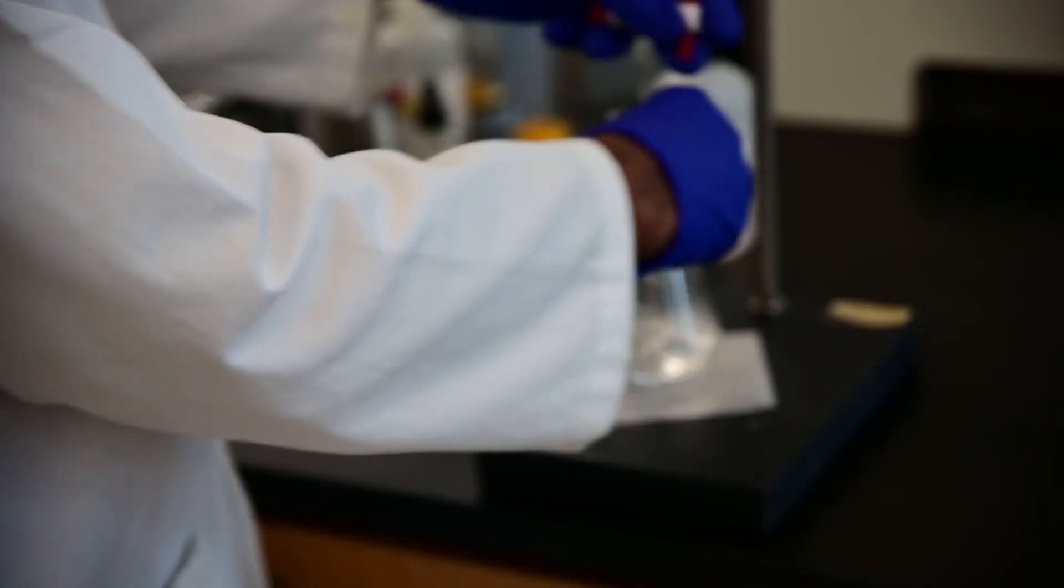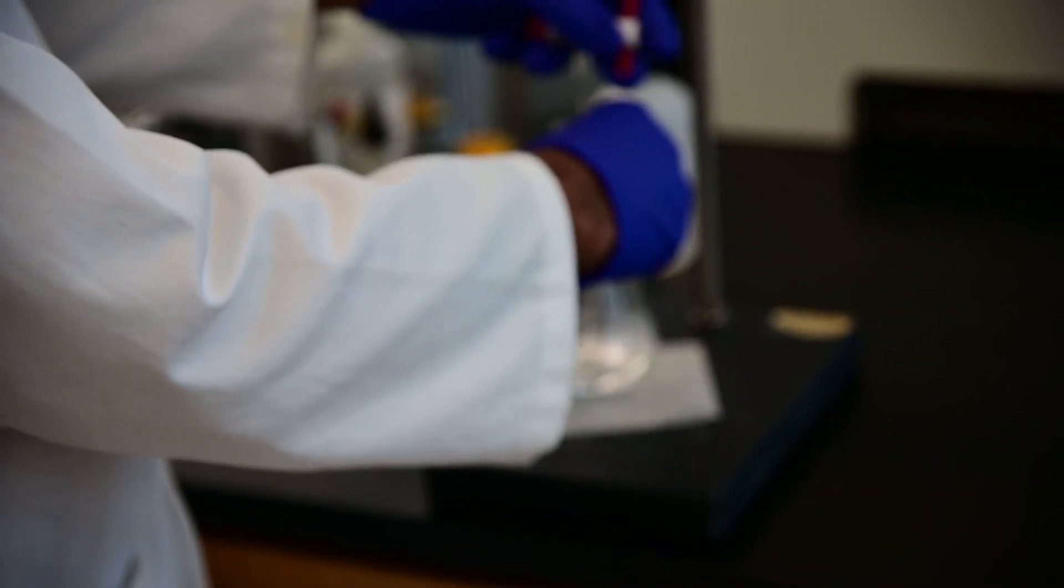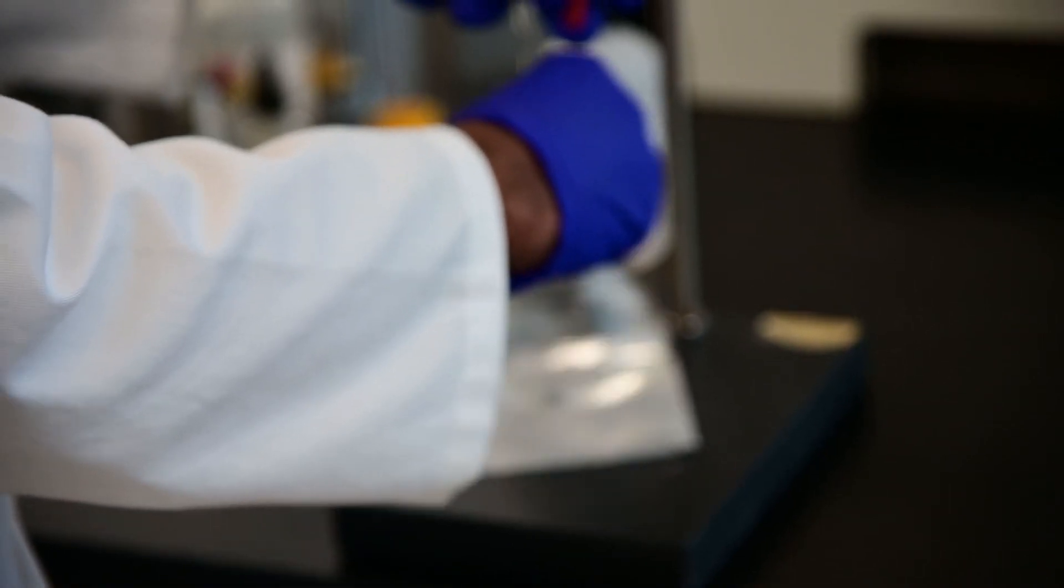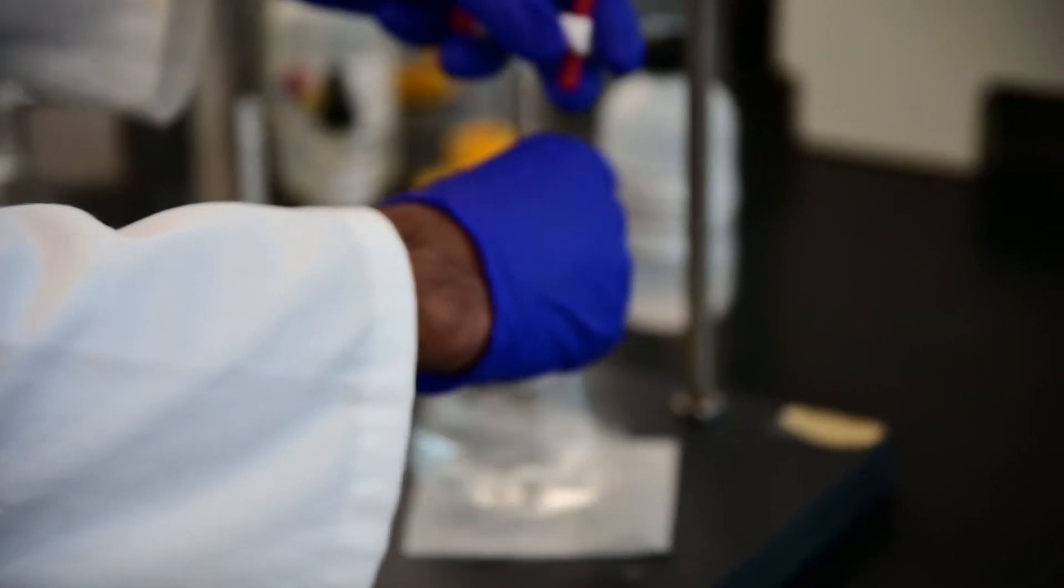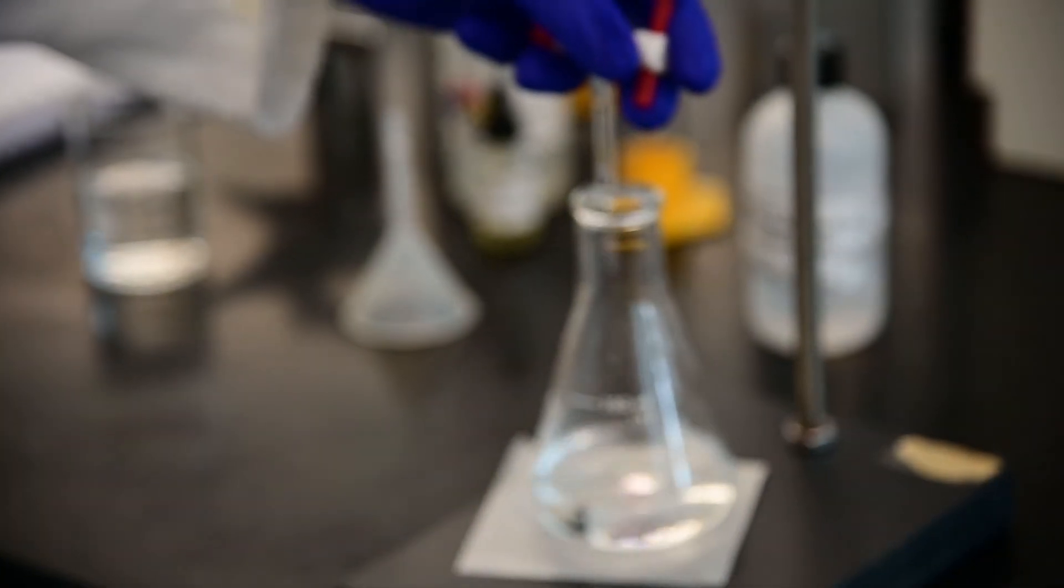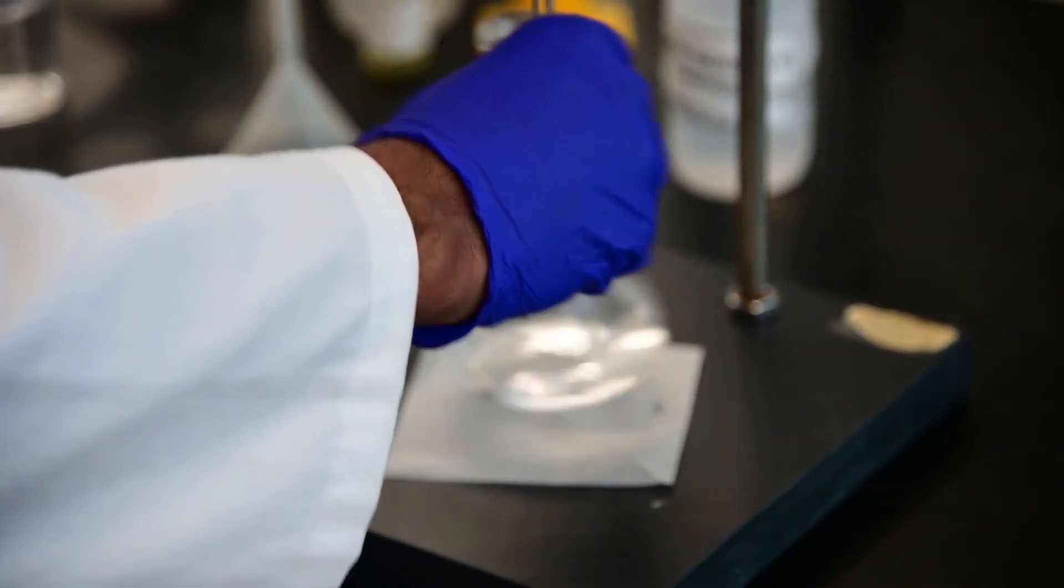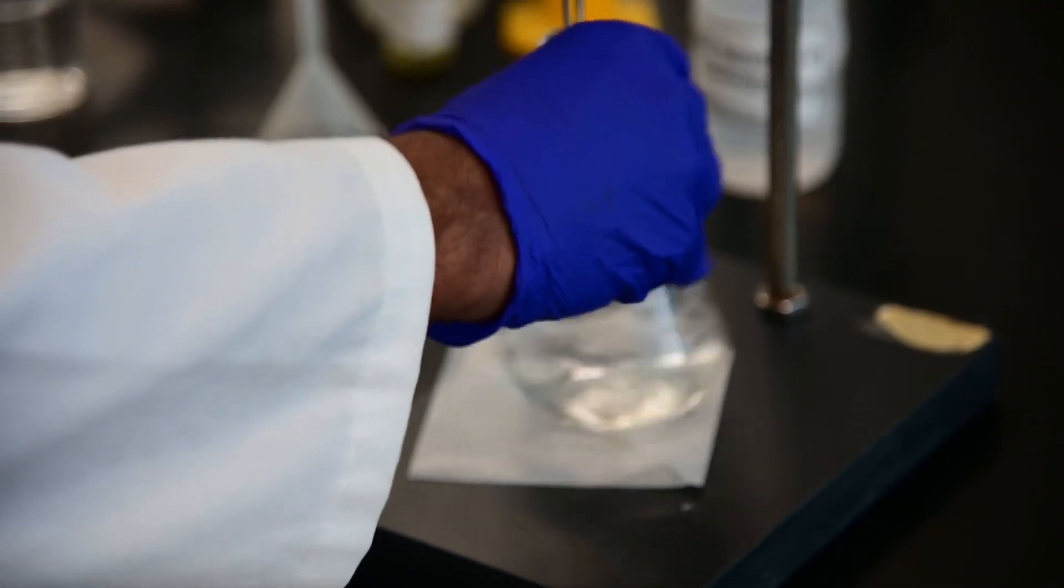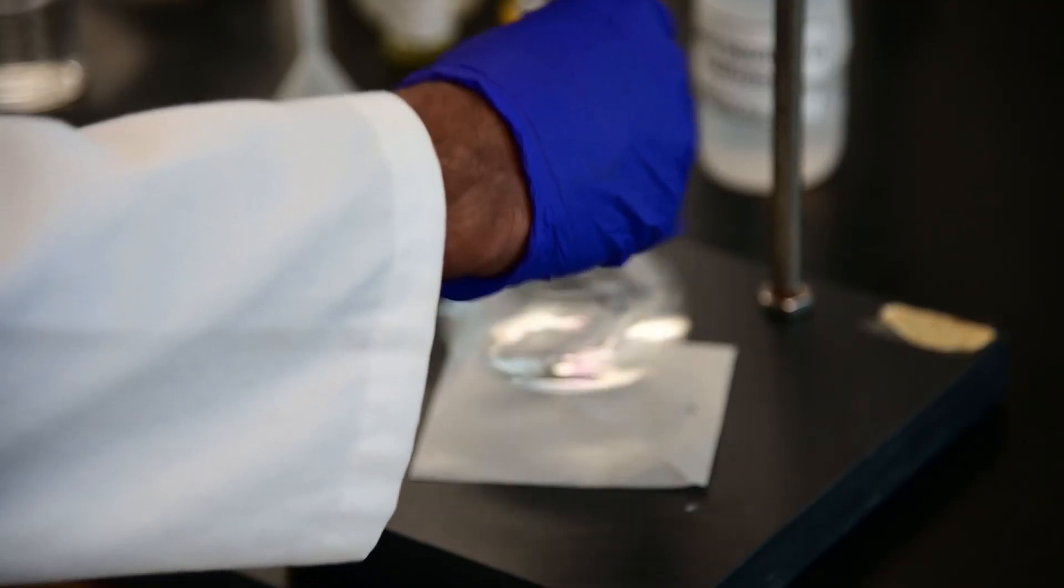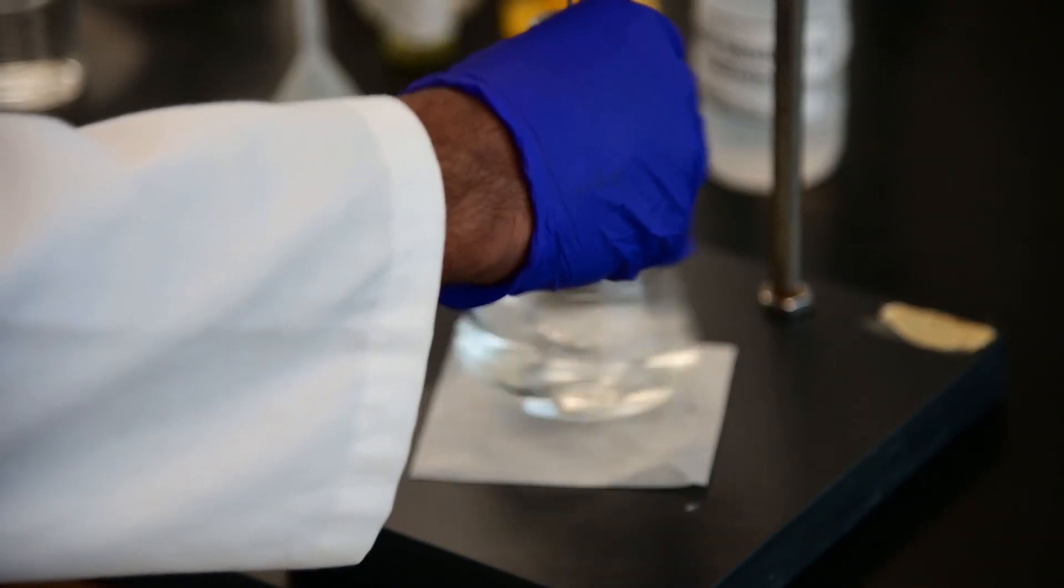If I don't shake it, what you will see as the drop falls in the solution of the acid where the drop is falling, it's turning pink. So that's the color of the indicator when there is excess sodium hydroxide in the solution. If I stop shaking, you can see the color. That's the local color. That's not the endpoint. How do I know that? Because the moment I shook it, the color disappeared. So that's why we are mixing it so that the reaction is happening throughout.